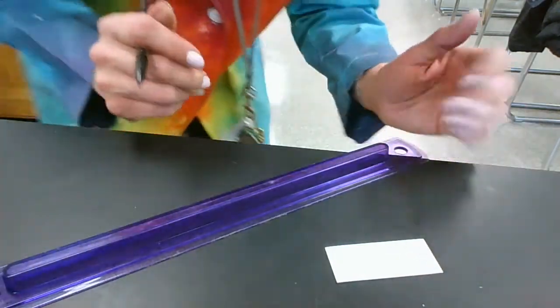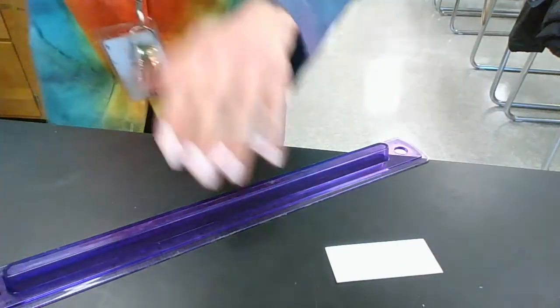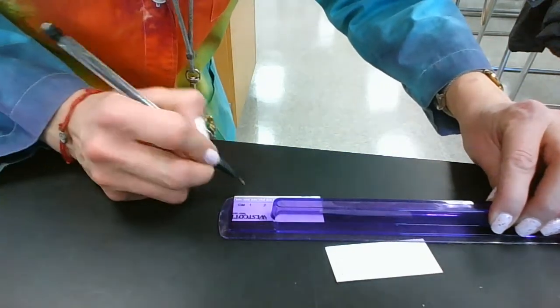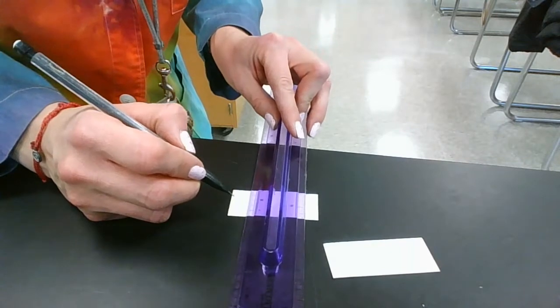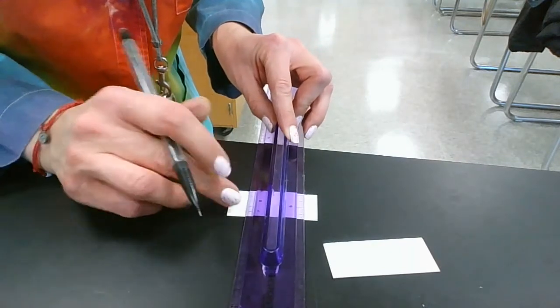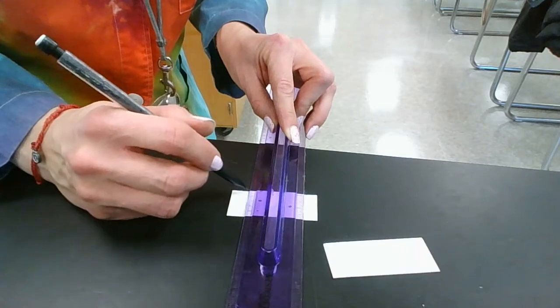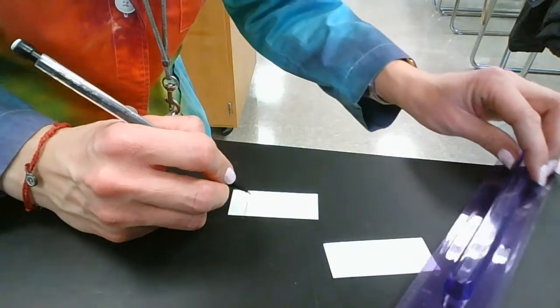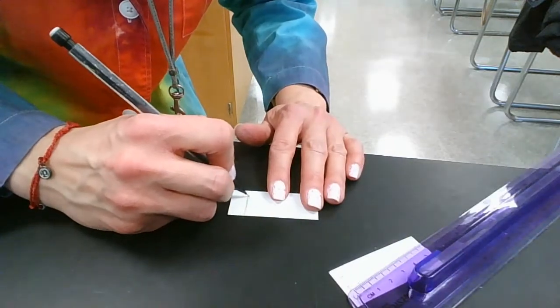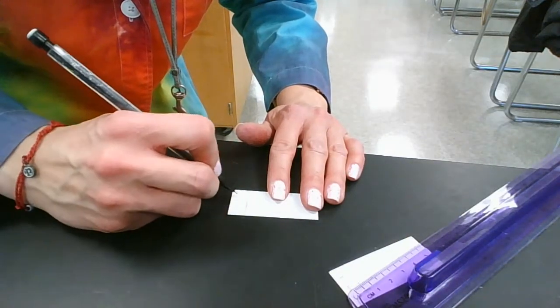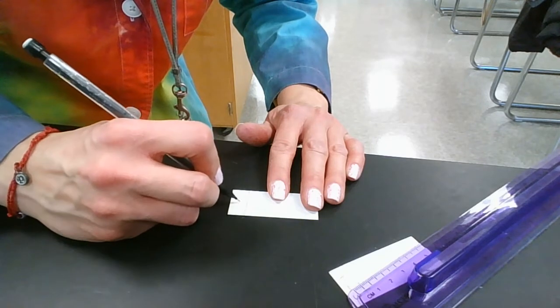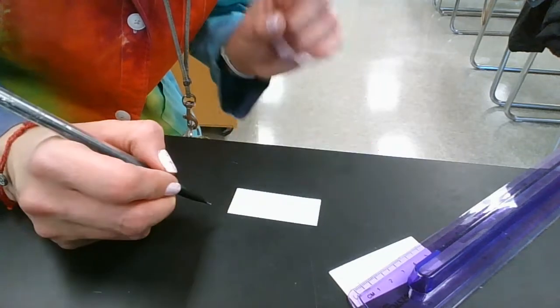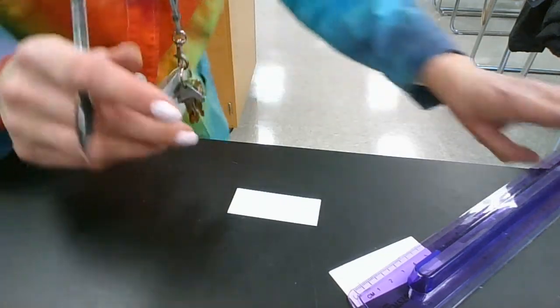Then on a second plate I'm going to need to do the same thing, so one centimeter and then nice and straight, and gentle with your pencil. Then make your hash marks, one two three hash marks. This is where I'm going to put compound four and five and the mixture that I'm assigned in class. You might be assigned unknown mixture one, two, or three by your teacher.